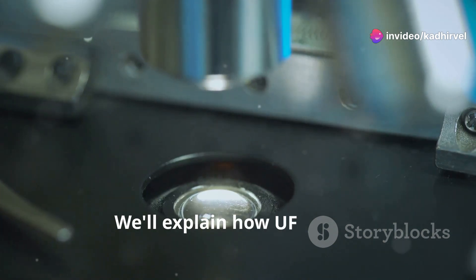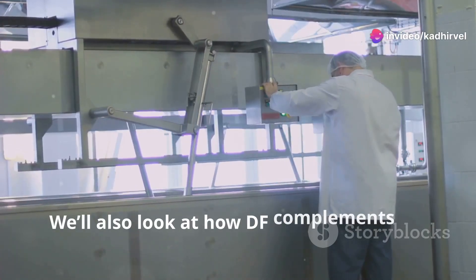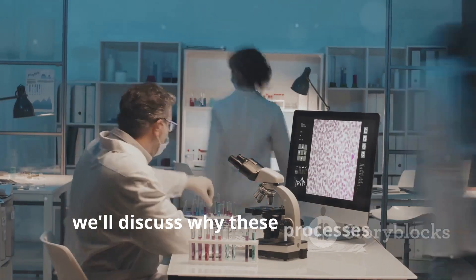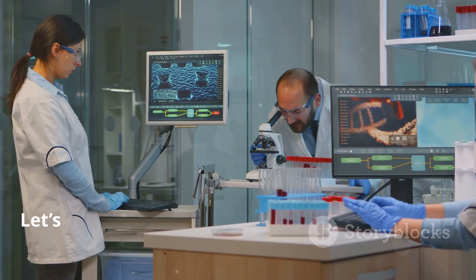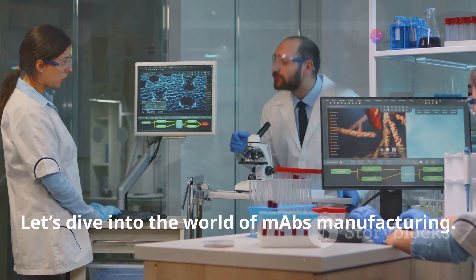We'll explain how UF works. We'll also look at how DF complements UF. Finally, we'll discuss why these processes are vital for quality and compliance. Let's dive into the world of MABs manufacturing.